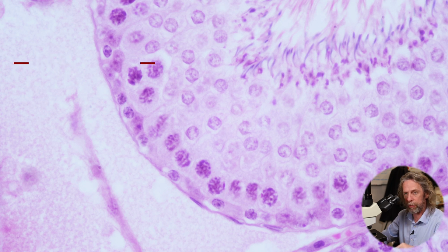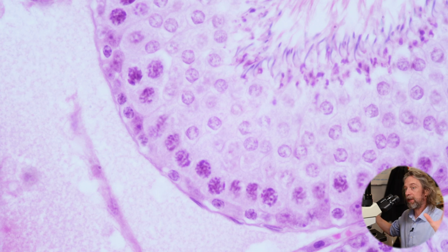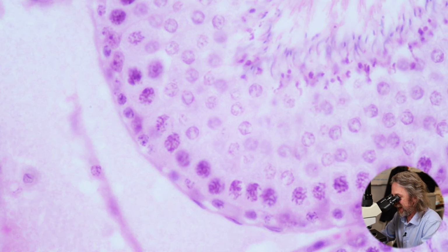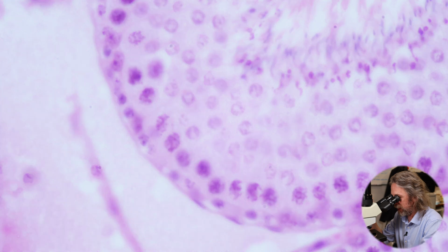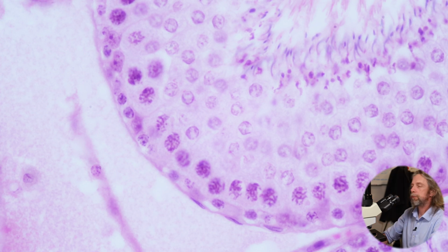You might see the notation 2N. So if they've got 2 sets of chromosomes, they're diploid cells. Most of the cells in the body have this, and these spermatogonia cells have that. Now, the cells and tissues here have been stained with a couple of stains, and the purple stain is staining the DNA. So the dark purple that we can see there is DNA. Where the stain is darker, we've got more DNA clumped together, and when that purple stain is a little bit more spaced out, that DNA is a little bit spaced out. So we are literally looking at the DNA there.